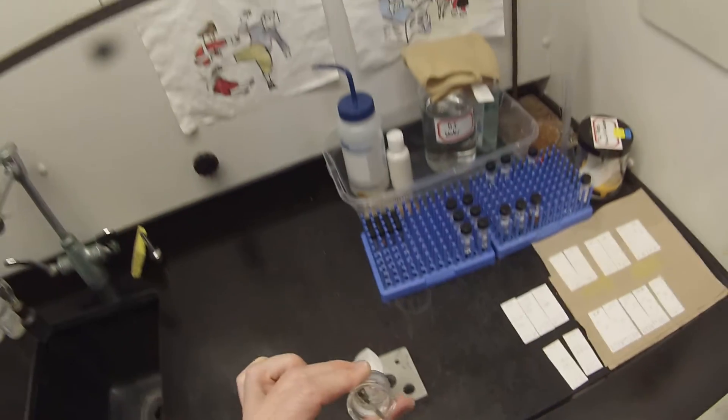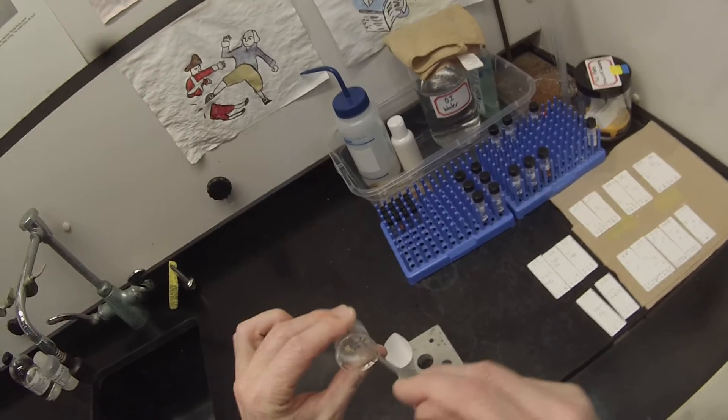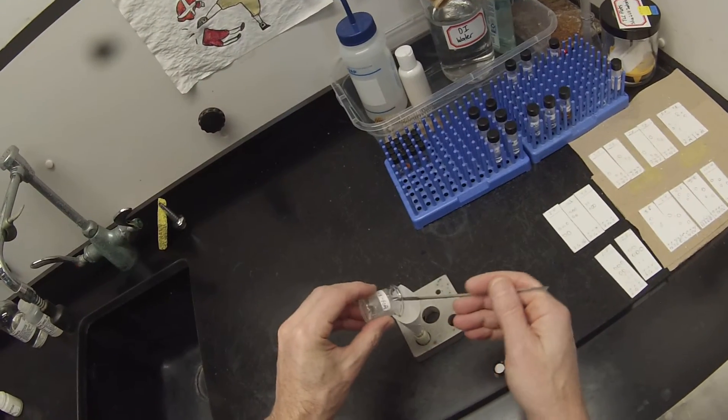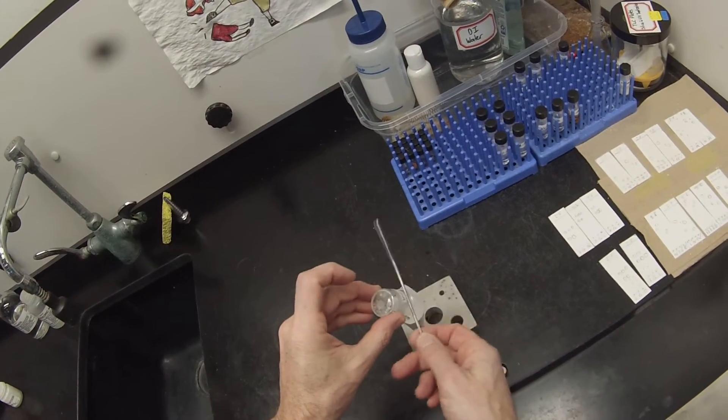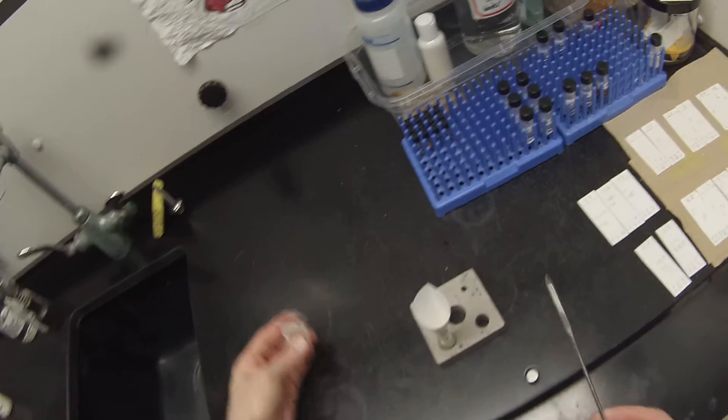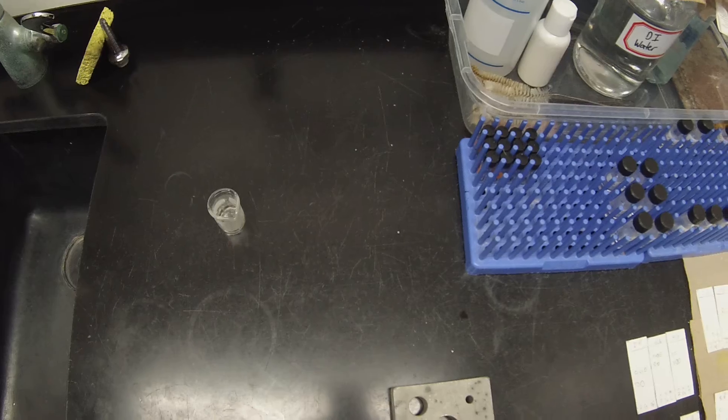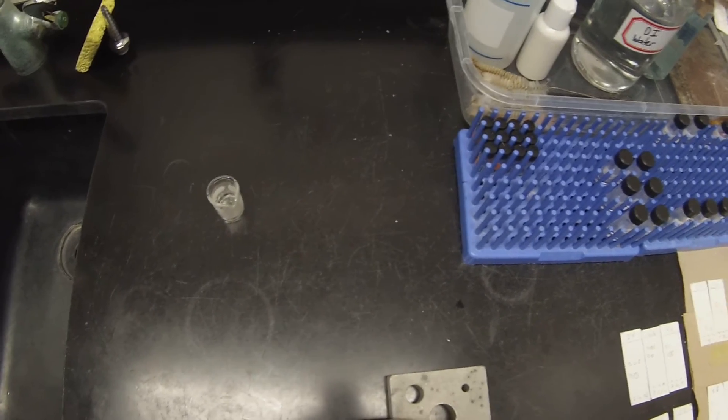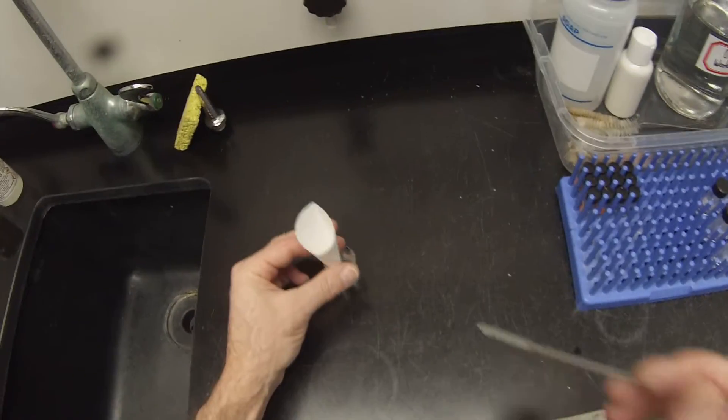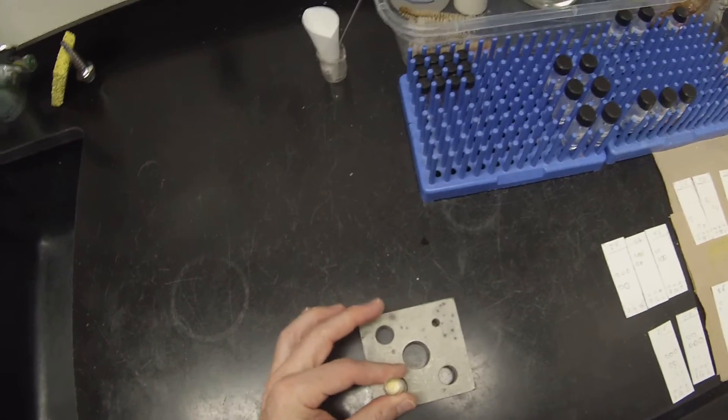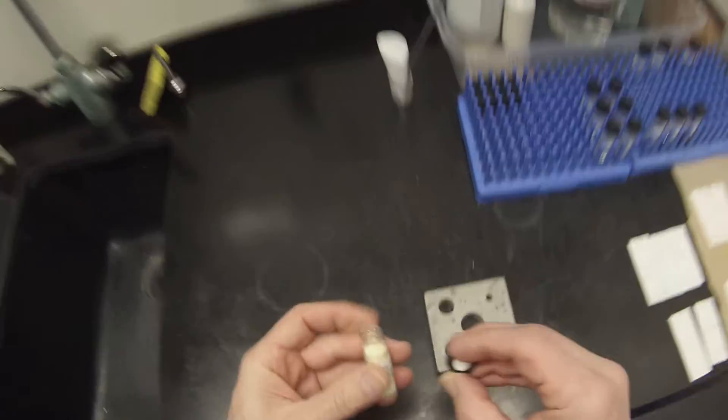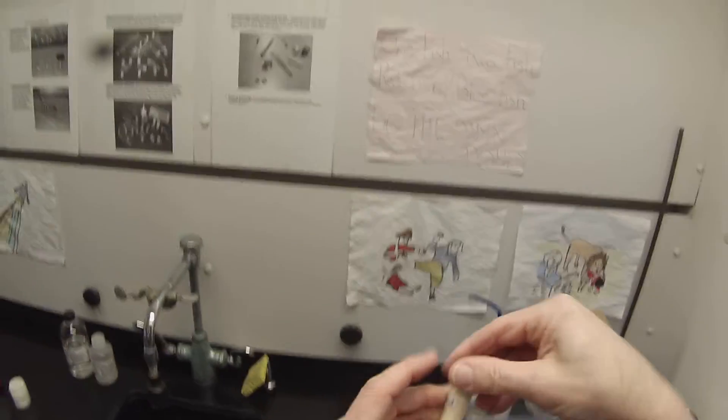So the last little bit. We've got a whole vial full of that.